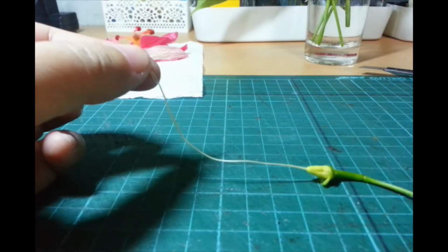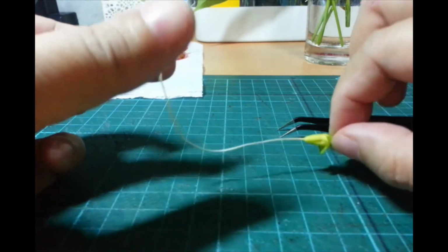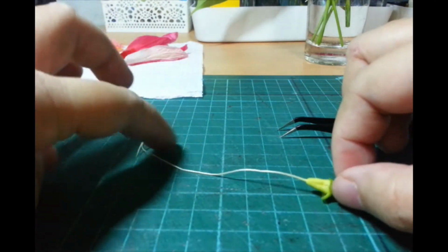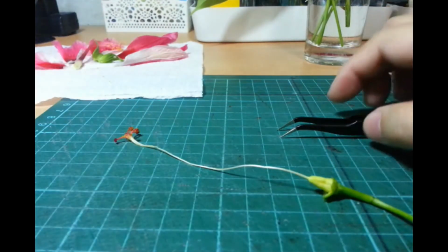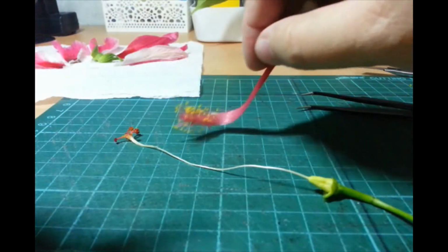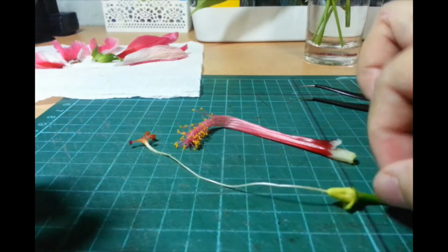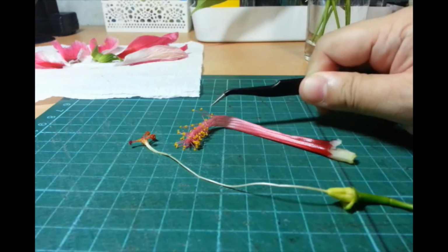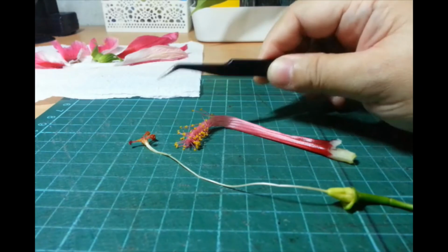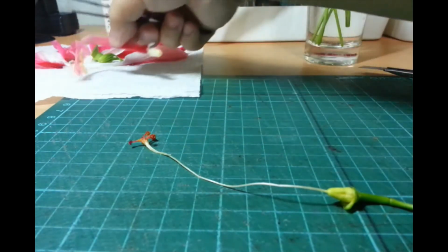Now, we're going to open it up to see what's inside the ovary. Kasi nga sabi natin doon, yung final destination ni male gamete. Okay? Teka, pagtabihin naman natin para, yan, si male at si female na magkatabi. Okay. So, male parts. The stamens are here. So we have a cluster of stamens here. And then the female part here, we have the pistil. Okay? So, sige. Tabi muna natin.